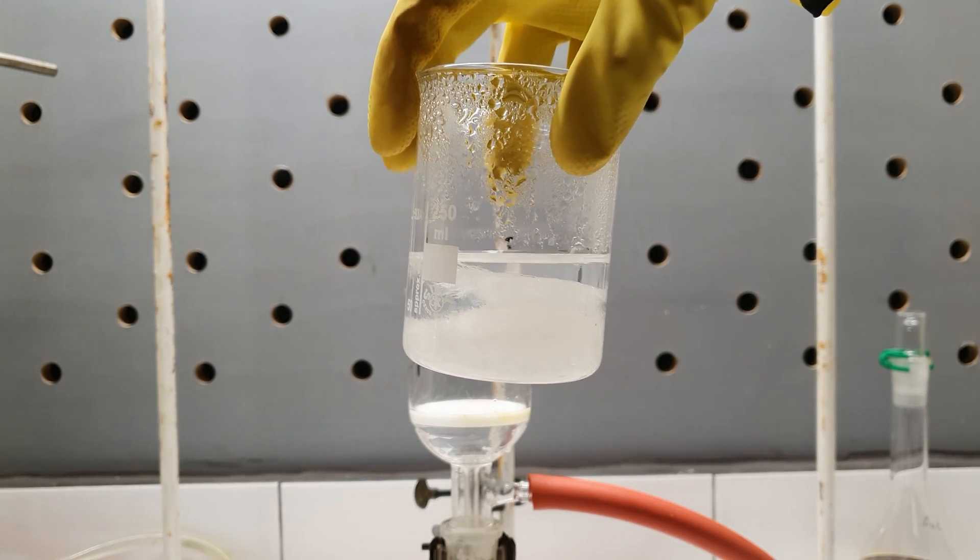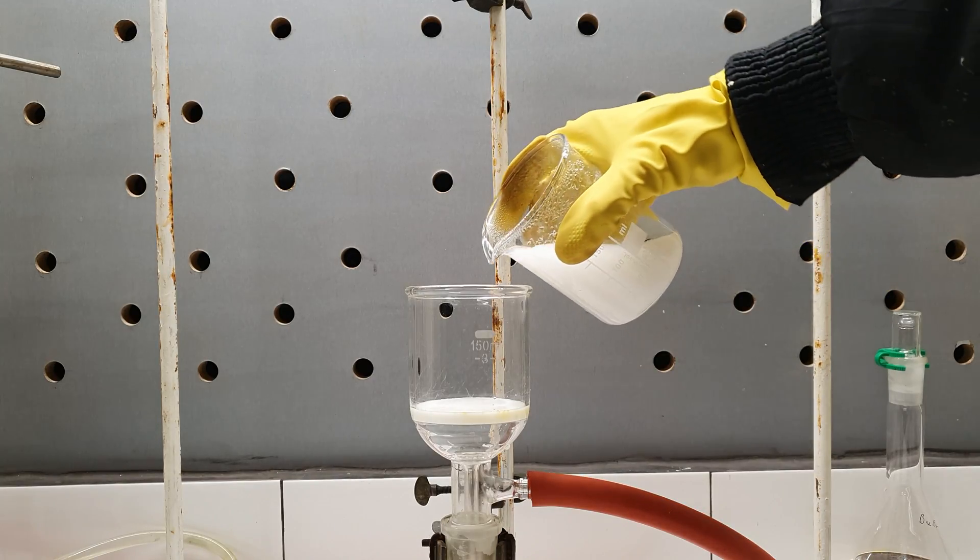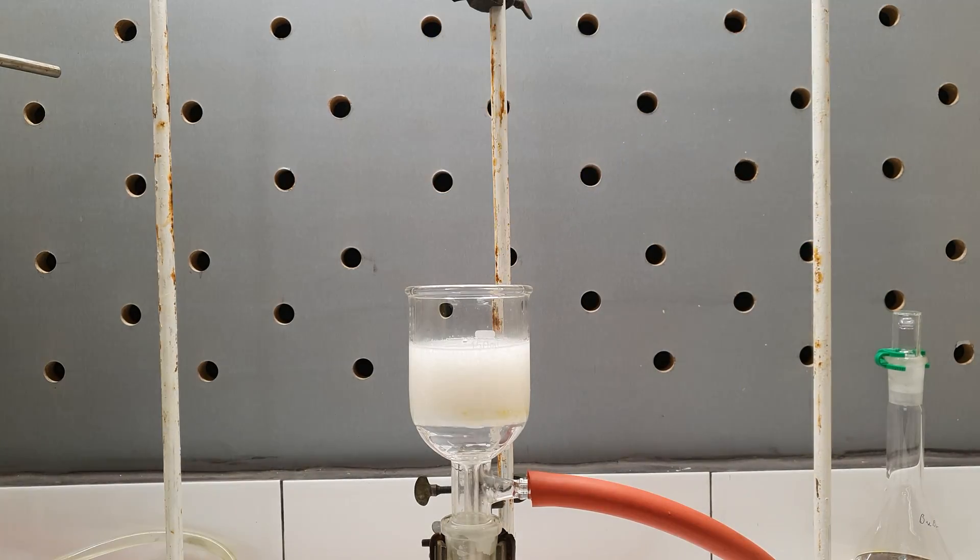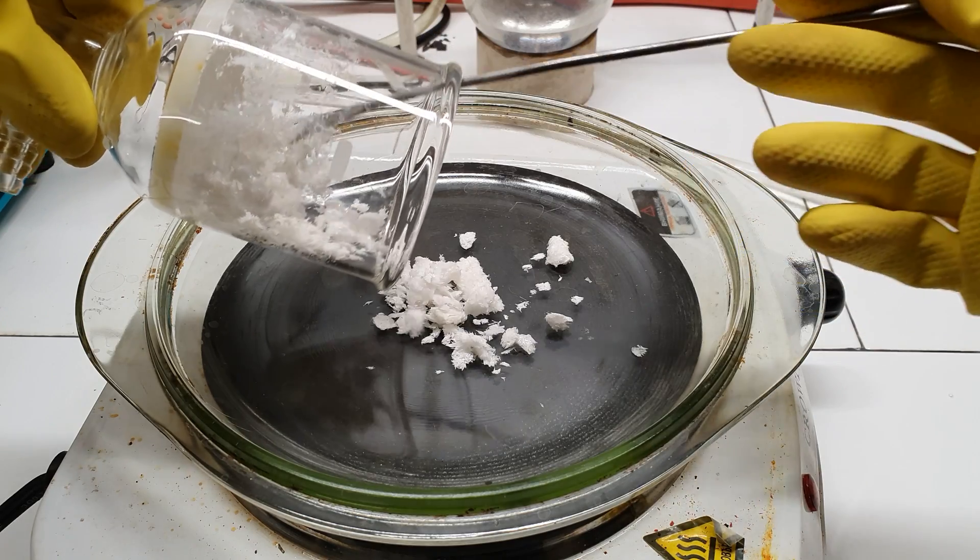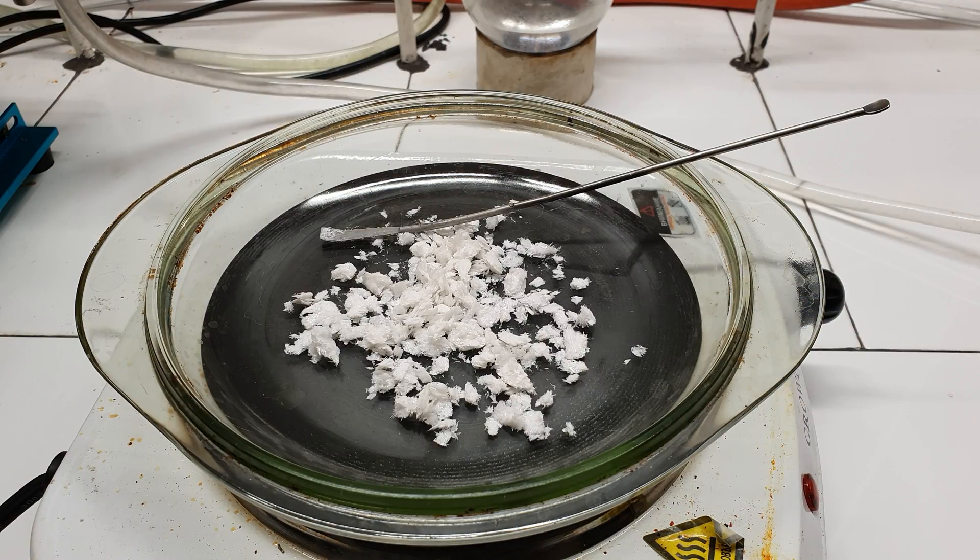After a few hours really nice needle-like crystals had formed. They were vacuum filtered using my pump and transferred on a crystallizing dish. To dry them more quickly I put the dish on my hot plate and turned it on on the lowest setting.